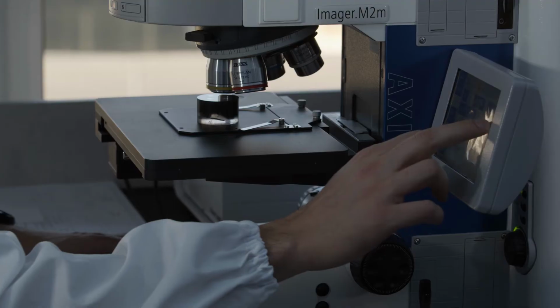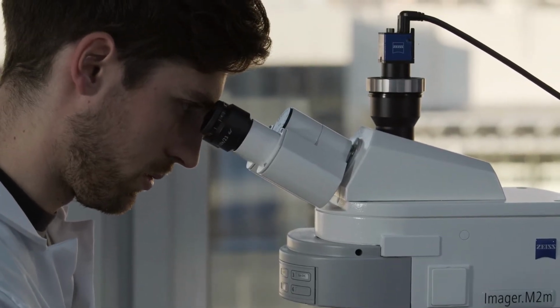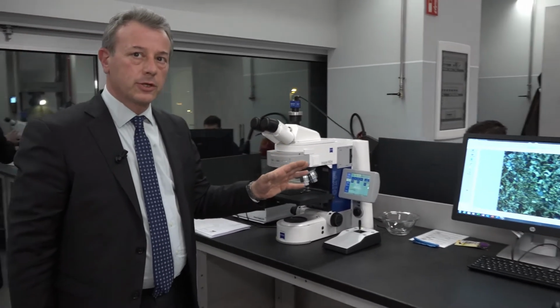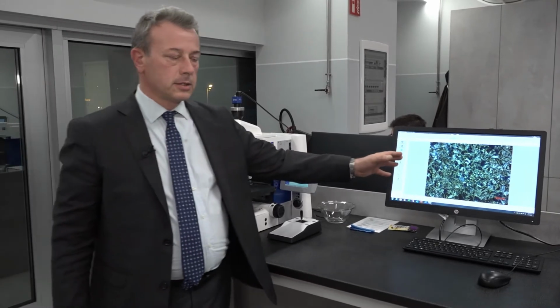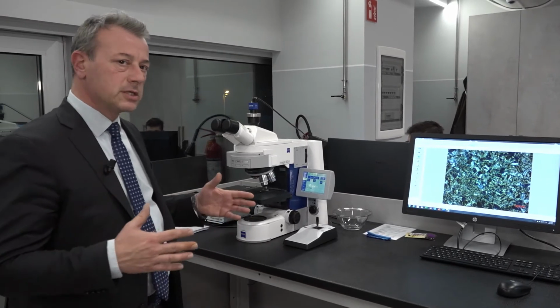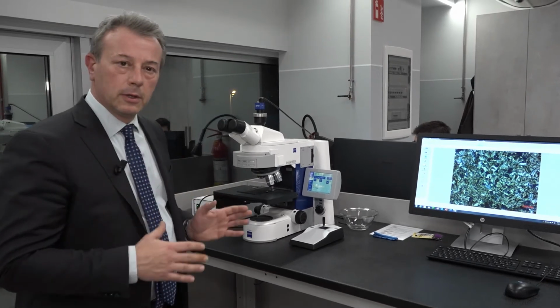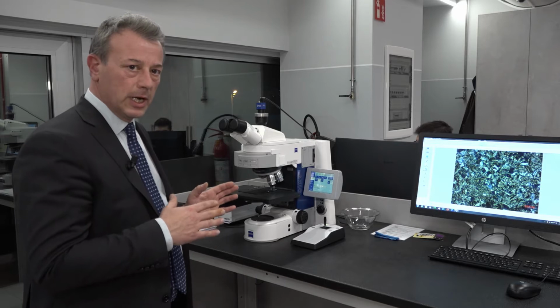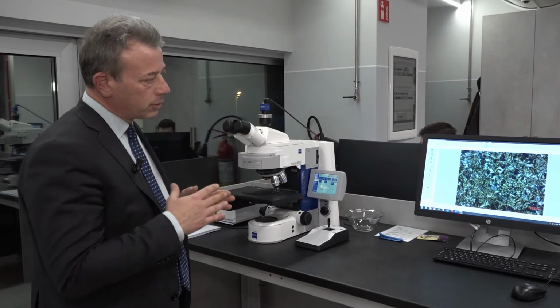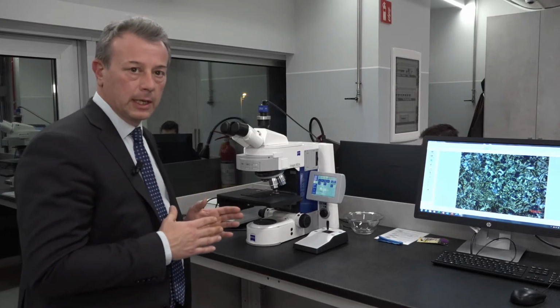Then on the other side here we have a microscope that we use to determine the structure, the reticular crystalline structures of the steel, like in this case, so to determine whether the steel is martensitic, austenitic or ferritic steel. And we can use this microscope also to check the surface treatment of the chain, for example, the zinc layer of galvanization, or to determine the quality of the welded area of a chain link.